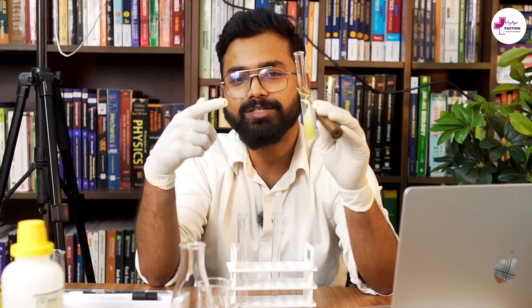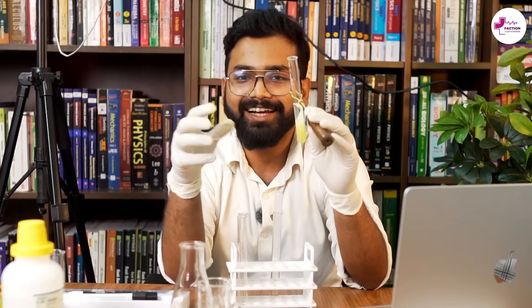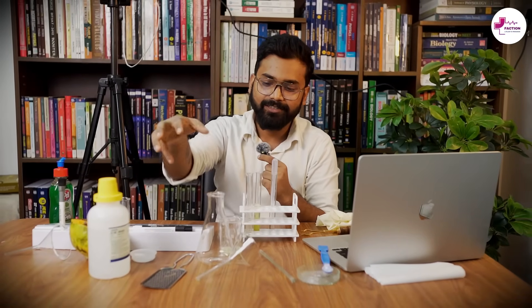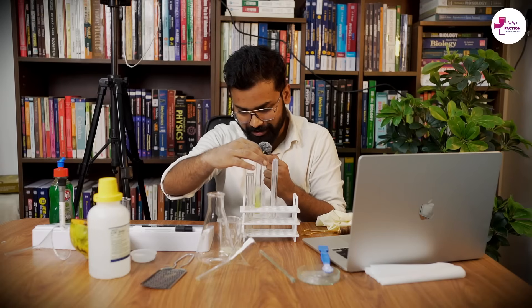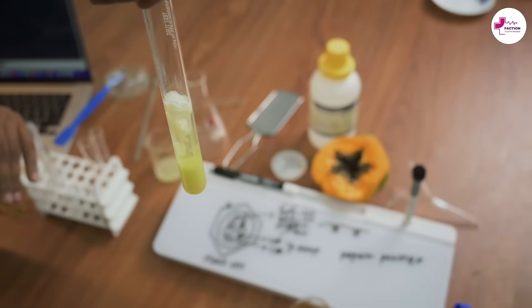That was all about the extraction of DNA — hope you had a great time during this experiment. We are now wrapping up. Zooming in, you can see the DNA is properly extracted. This is the DNA I was talking about — this is how it actually looks.